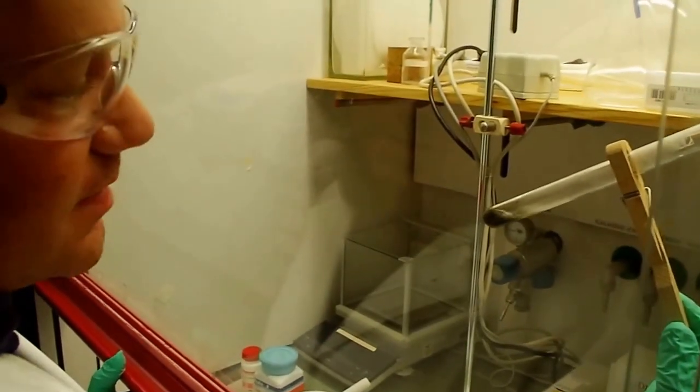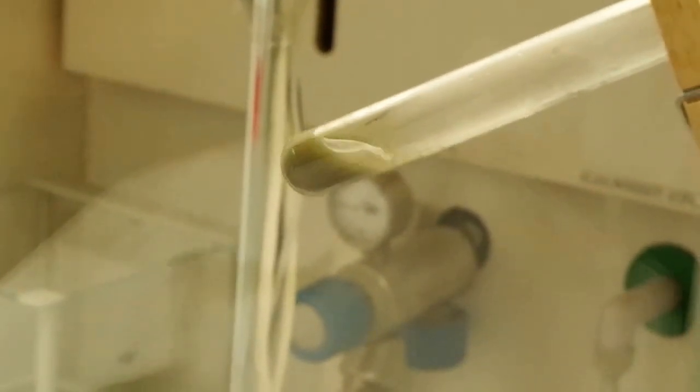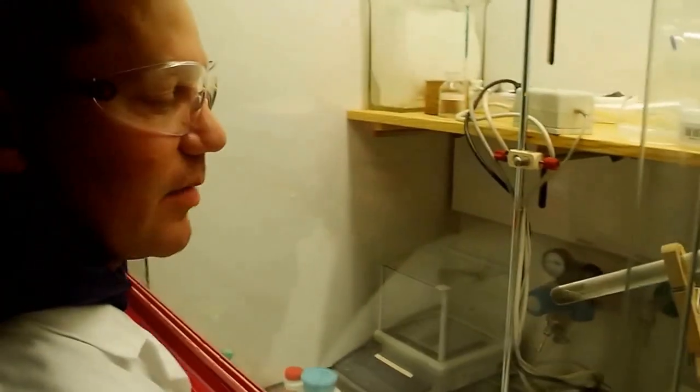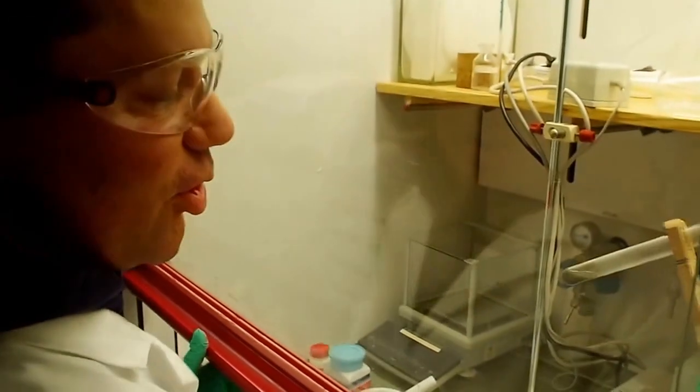Actually what happened is that the cadmium precursor is not stable in alcohol above a certain temperature. So now we did not control the temperature. I set it to 500 degrees. So what happened is that in alcohol the cadmium laurate decomposes into elemental cadmium, you must believe me.